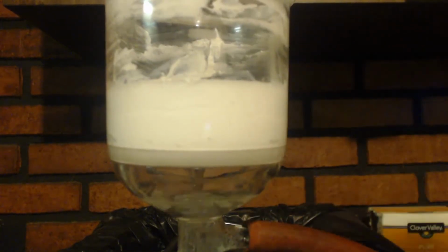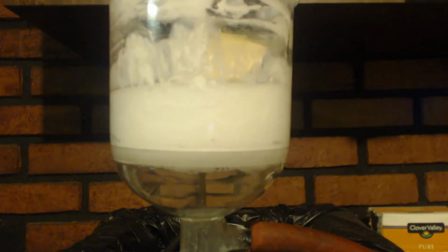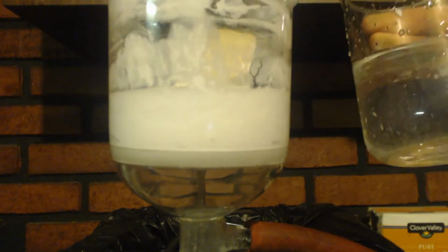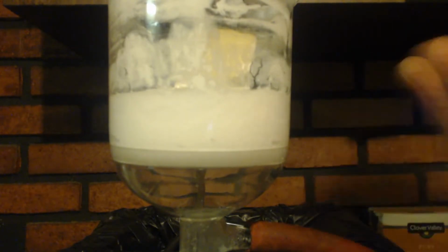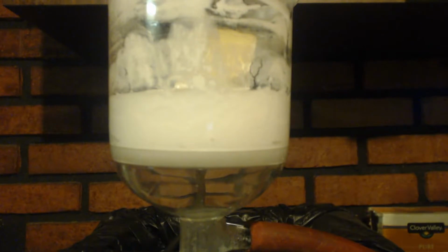Okay, so I'm going to suck all this water out, right? And then I'm going to add, you see I got some more in here. See there? Clean some more of that out. Total, probably I'm going to use about 400 to 500 milliliters, and put 100 milliliters in at a time. Stir it around, and then put a vacuum on it and let it get most of the water out. It's not going to be dry, it'll still be kind of like pudding. And I'll just repeat that until the water's gone, and that should make it clean enough.